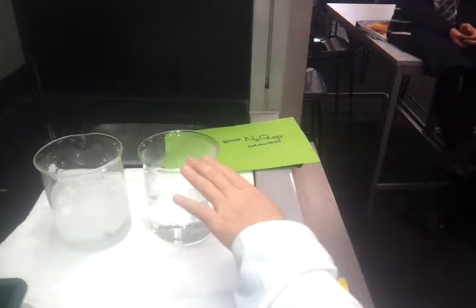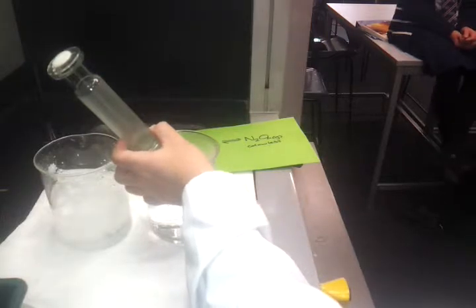The one farthest away from you is iced water, so that's on the left hand side in the video. The one nearest you, so the right hand side, is about probably 40 degrees, so relatively warm water. I'm going to put the syringe into the warm water and just take note of that colour and we'll see if it changes. Now of course, being warm water, it's increasing the reaction rate in both directions. So we notice, oh, it's trying to change the pressure quite dramatically.